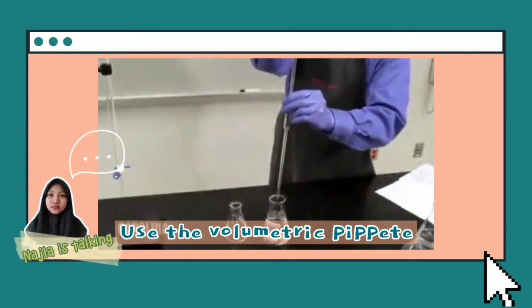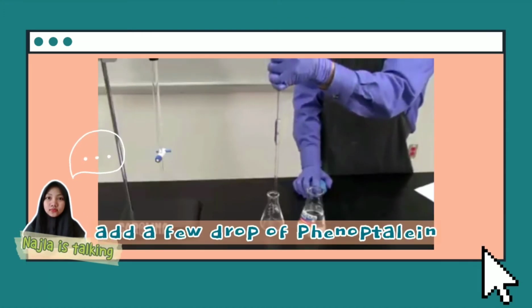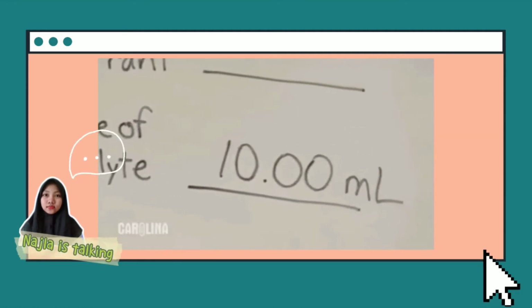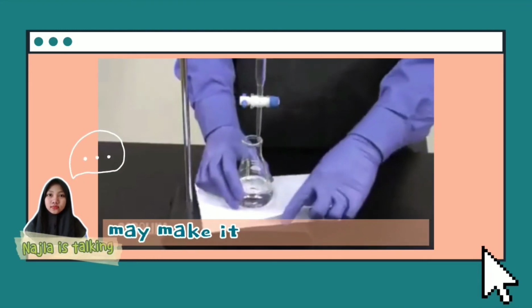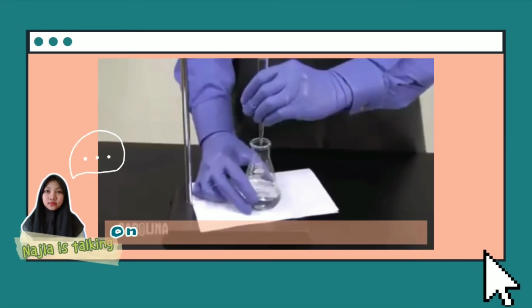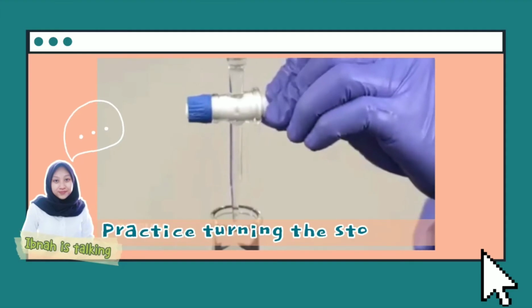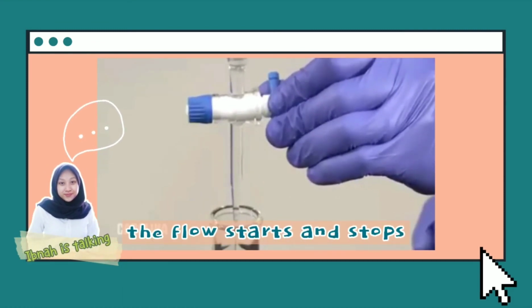Use the volumetric pipette to transfer the hydrochloric acid as the analyte to the flask. Add a few drops of phenolphthalein as the indicator to the flask and swirl. Place the flask under the tip of the burette. Record this volume. Placing a piece of white paper under the Erlenmeyer flask may make it easier to detect the color change. Operating the burette requires two hands. One hand turns the stopcock while the other hand swirls the flask. Practice turning the stopcock a few times to familiarize yourself with how quickly the flow starts and stops.